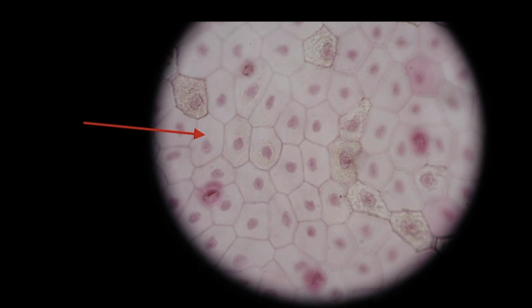But once you run through it a second, third, fourth time, then you'll see how that'll be useful to you. You'll have a chance to guess what it is before I actually tell you what it is. And you can slow down the video, speed up the video as you need. I will go fast through these tissues, and you can adjust the speed as you wish from your end.